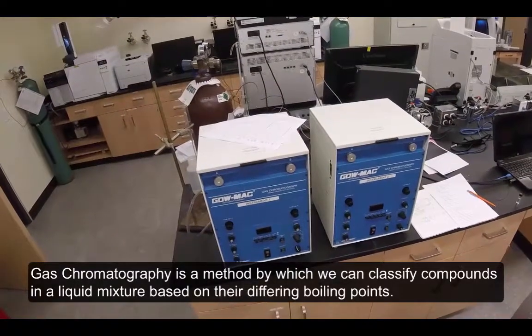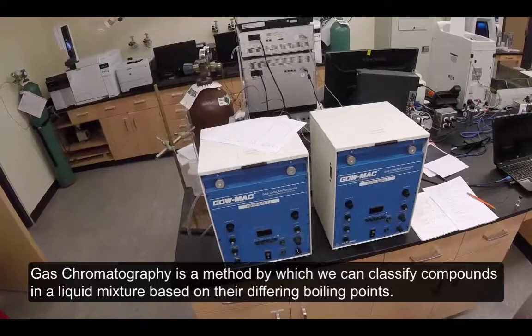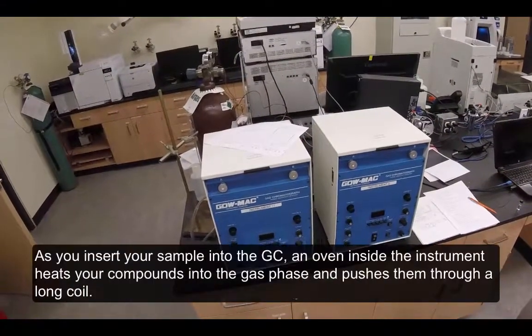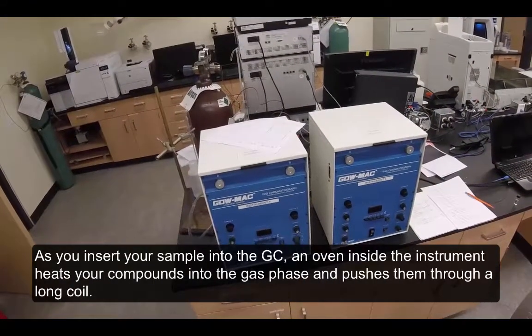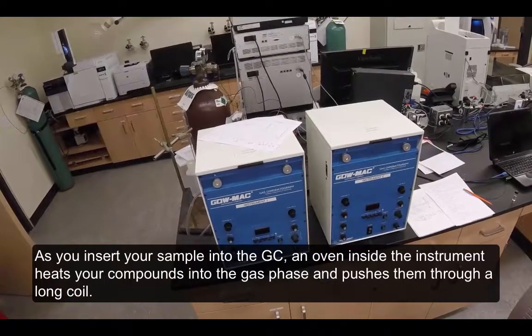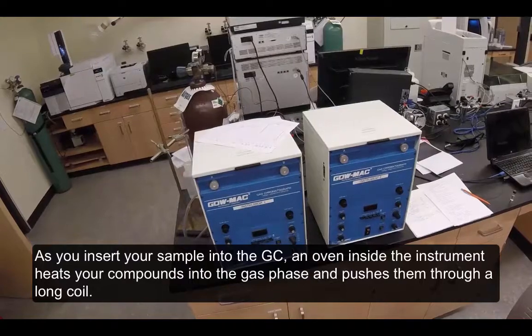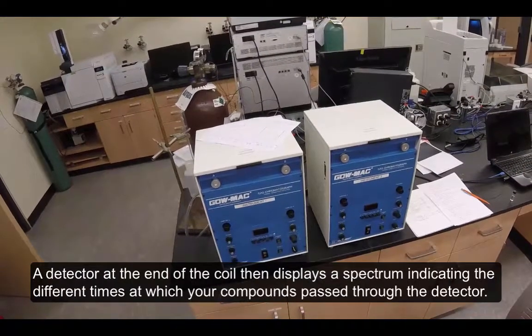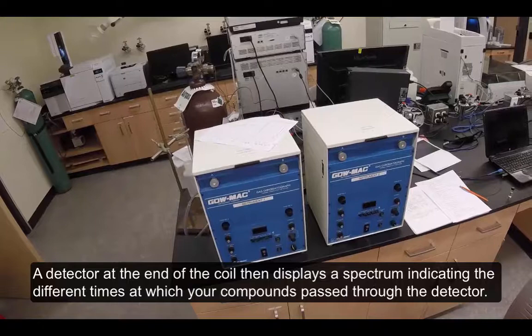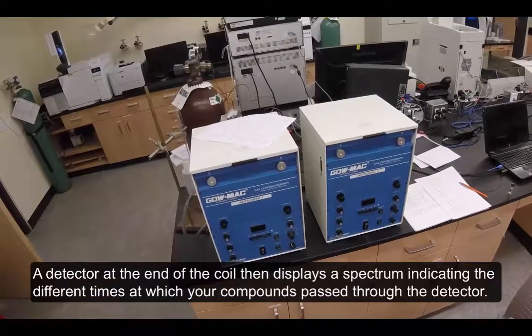Gas chromatography is a method by which we can classify compounds in a liquid mixture based on their different boiling points. As you insert your sample into the GC, an oven inside the instrument heats your compounds into the gas phase and pushes them through a long coil. A detector at the end of the coil then displays a spectrum indicating the different times at which your compounds passed through the detector.